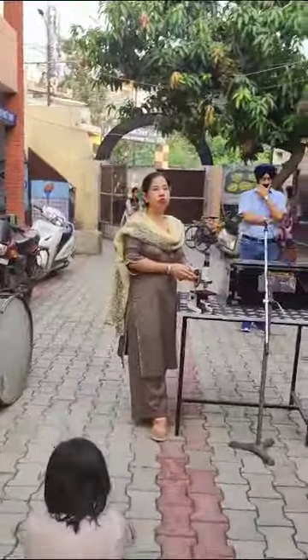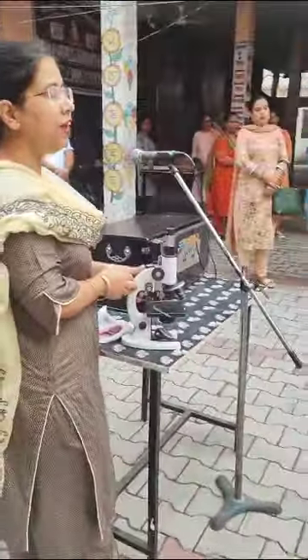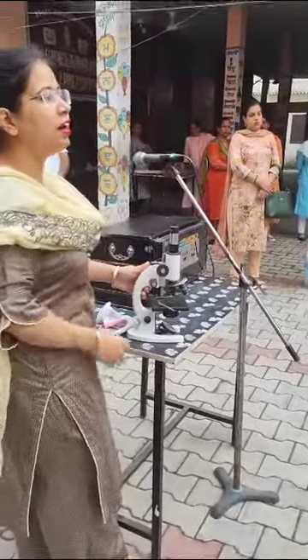A microscope is used to see micro-organisms which cannot be seen by the naked eye. Naked eye means that you cannot see things without any aid.